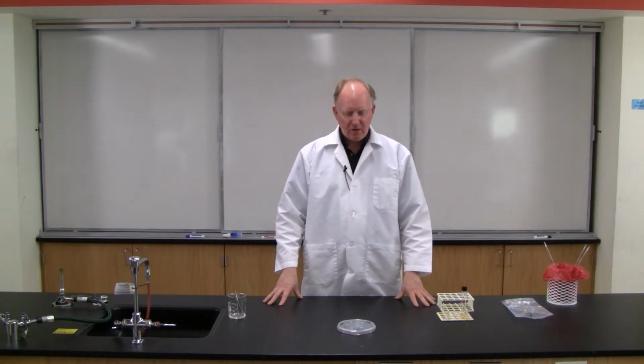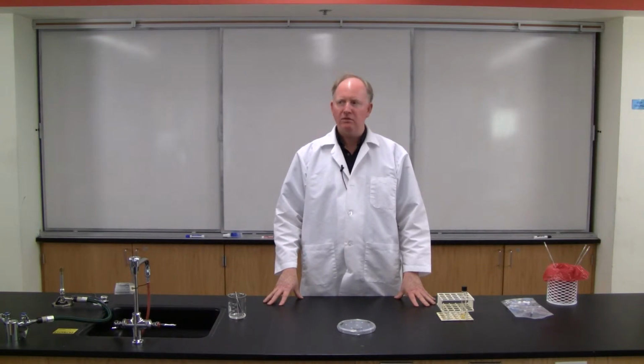Okay, and then all you got to do now is incubate your plate for 18 to 24 hours at 37 degrees Celsius.